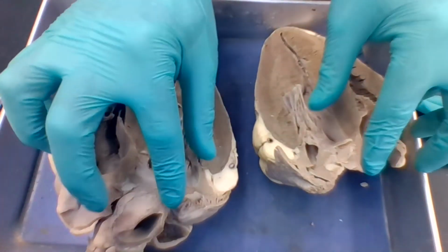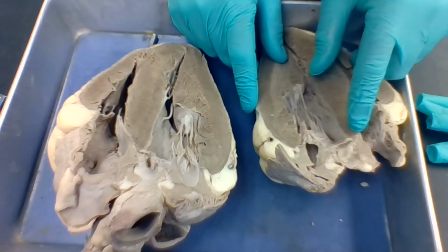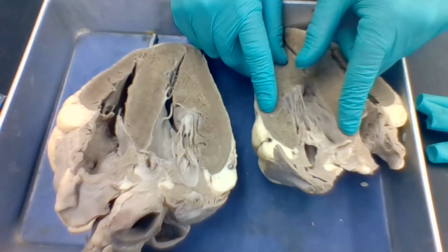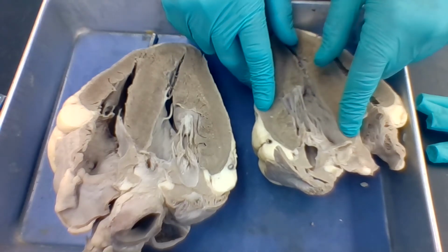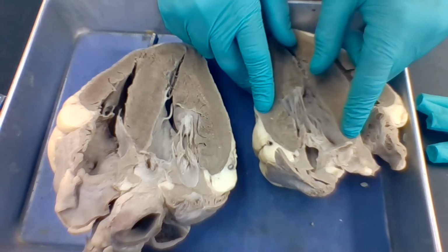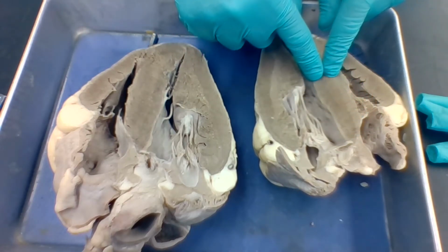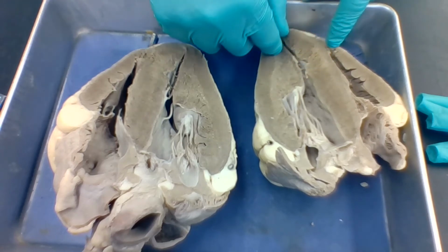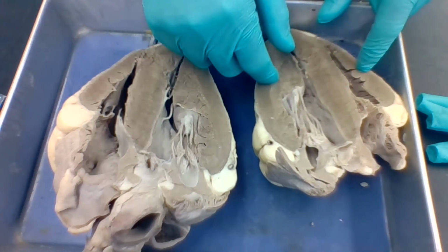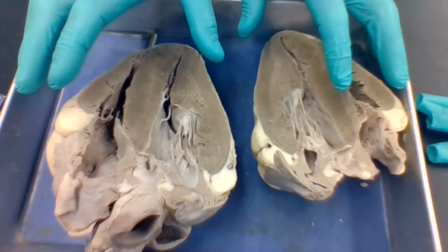The atria are going to simultaneously contract, and then that depolarization wave, that conductance, is going to reach an AV node, atrioventricular node. And now it's going to travel down through right and left bundles, and then up the sides, the walls of Purkinje fibers, and then that's going to cause the ventricular walls to contract.